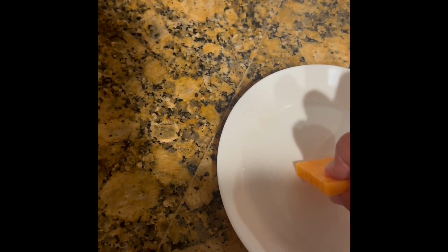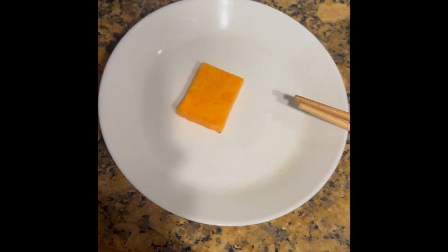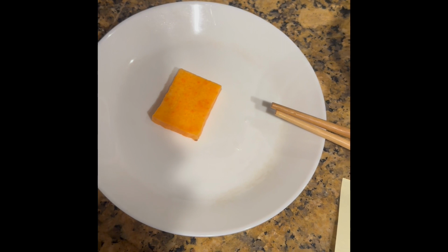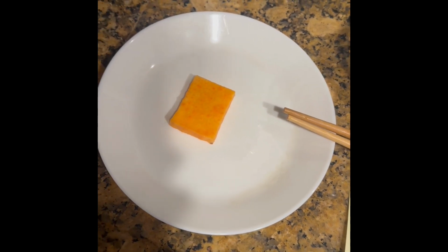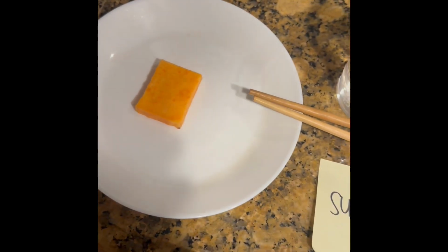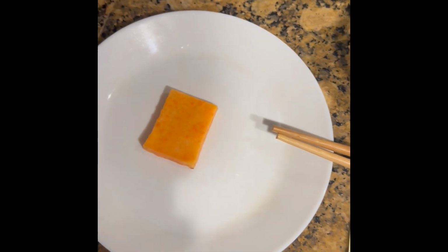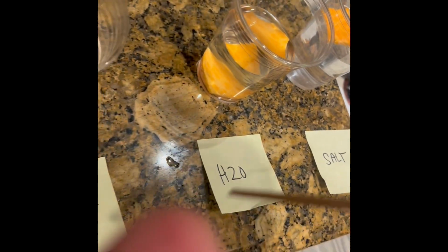It's very crisp. The reason it grew in size is because this potato was placed in a hypotonic solution, meaning the potato was placed in a solution with lower solute concentration, causing water molecules to move into the cell, or potato in this case, which caused it to grow in size and the cells to expand.